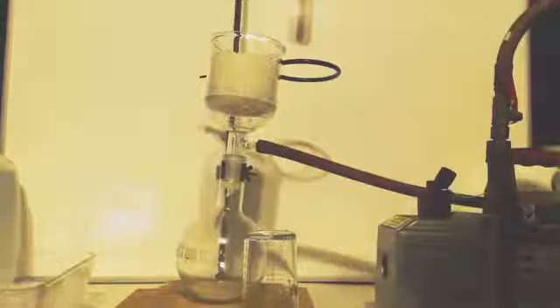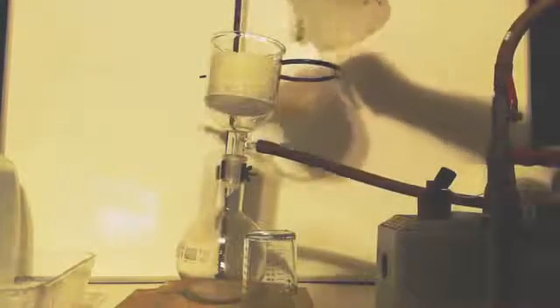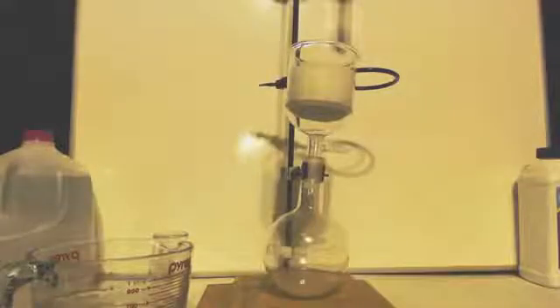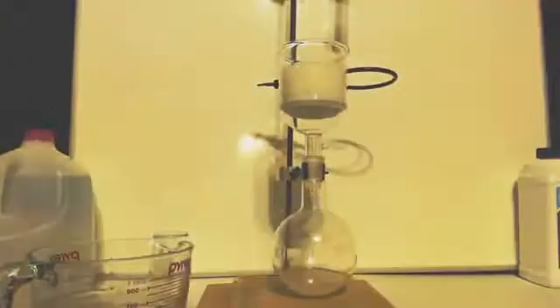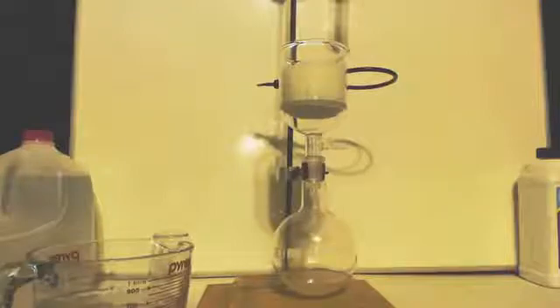I've got a little bit of ice water I'm going to dump into it. I'll let the pump run for about 10 minutes - I probably should have let it run for 20-30 minutes to try it out. You can see at the bottom there there's some liquid. I would actually recrystallize this and put it in a separate batch called 'somewhat pure' because there's no sense wasting it.